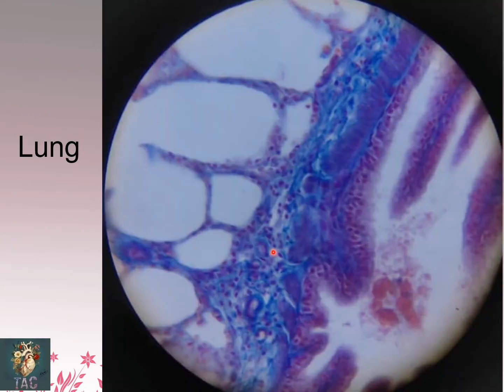So this is a beautiful slide taken from a thin segment of the interalveolar septum and the thick section from the bronchi. So this is the epithelium of the bronchi, that is pseudostratified epithelium with the cilia which are present over here, and beneath the epithelium you can see these are the smooth muscle cells which are forming the wall of the bronchi, and here you can see these are the pieces of the cartilage which are present. Here you can see the chondrocytes as well present in their lacunae, and then a smaller amount of connective tissue.